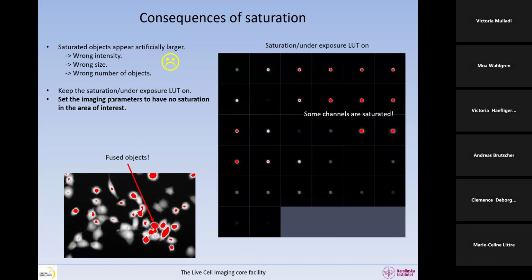Because they fuse. So it is really important. I do not know any application where it's okay to make do with saturation, as I say, in the area of interest. If you have something that is excluded from the analysis, that's okay. But if in the area of interest, there is no application where you actually get away with saturation. And again, I would certainly reject it as a reviewer and say, please give me a non-saturated image. So keep the saturation lookup table on, and set the imaging parameters to have no saturation at all in the area of interest.